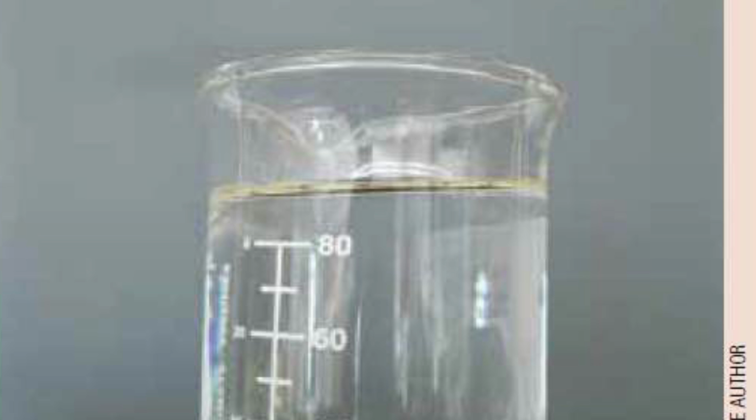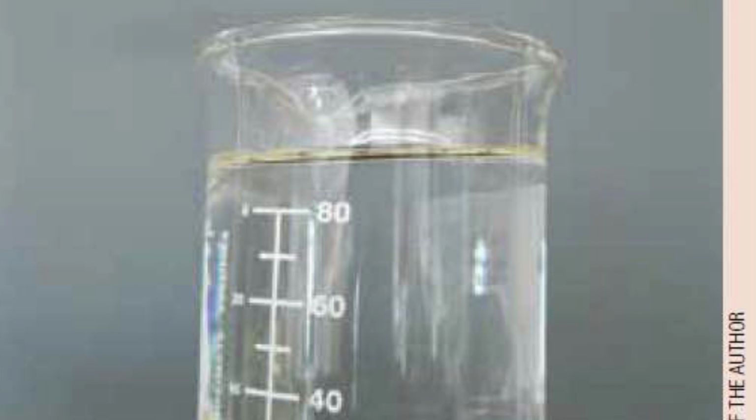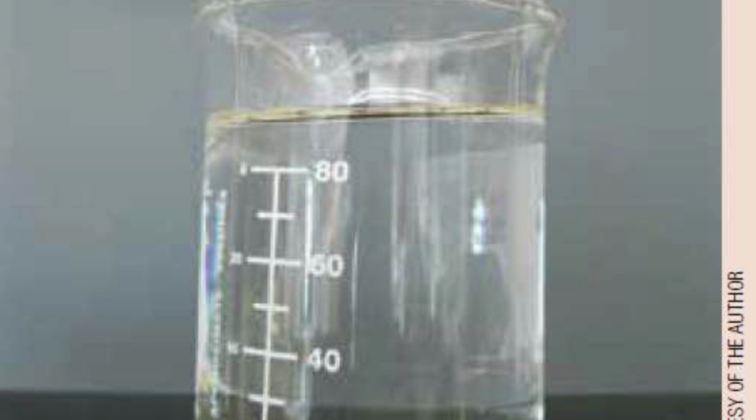On the bottom it should form little spheres or balls of just yeast, as you can see at the bottom of this beaker. So we're going to go through this lab and I'll explain the reactions and why they happen.